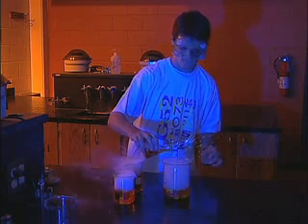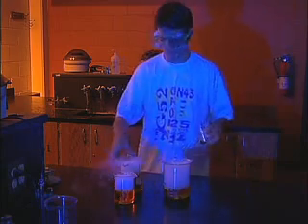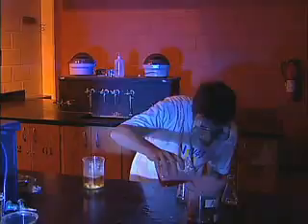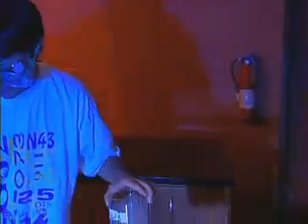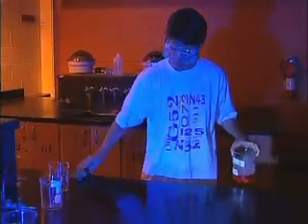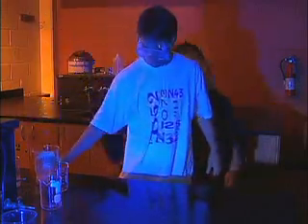You know, you would have thought he'd learned his lesson by now, but he hadn't. Rule number 2, performing unauthorized experiments or any experiments at unauthorized times is forbidden. Rule number 11, all lab workers should also know the location of at least 2 fire exits.